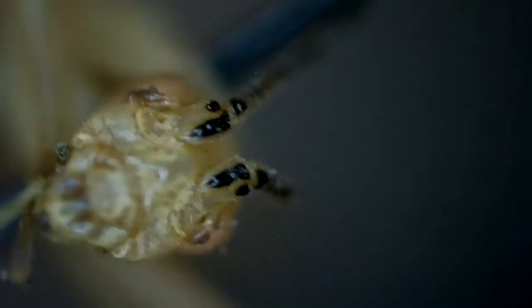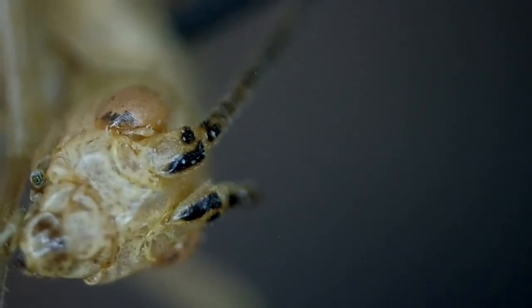The first species we're going to look at is Argentinus. There will be some blurry moments in this part of the video, but you can see the markings right on the base of the first antennal segment, and then on the second one as well. Based on those markings, combined with the collection locality and range maps, that's how I identified this specimen — it was collected in Texas.